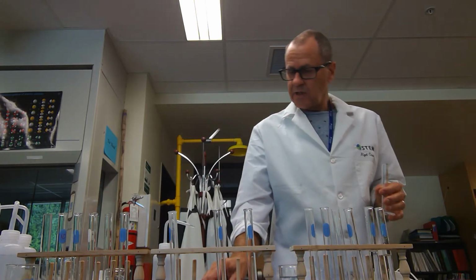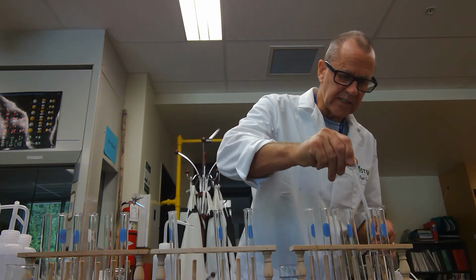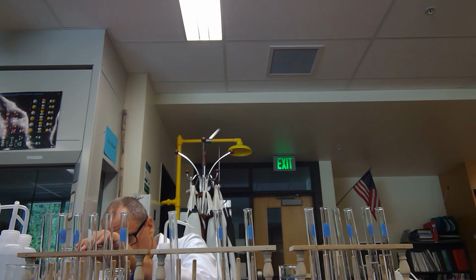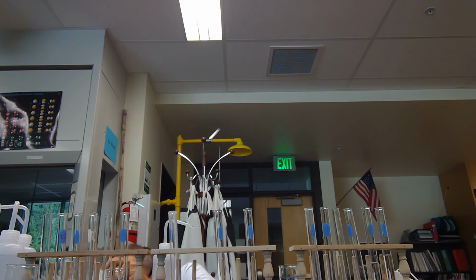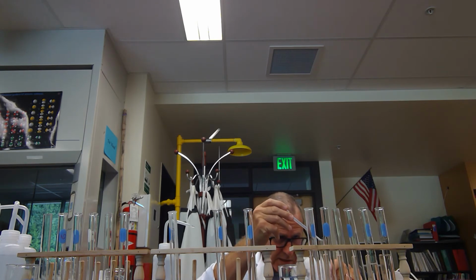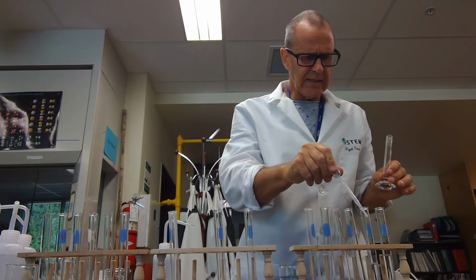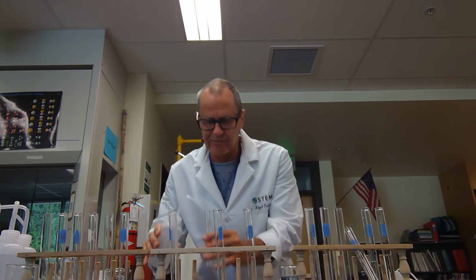The next thing I'm going to do is exactly the same. And I'm going to take 1 milliliter of this. Oh, that's too much. Well, let's pour that out. Oh, not bad. Need some more. 1 milliliter of this. And as you can guess, I'm going to fill it up to 10. Oops, better do that first, with distilled water.